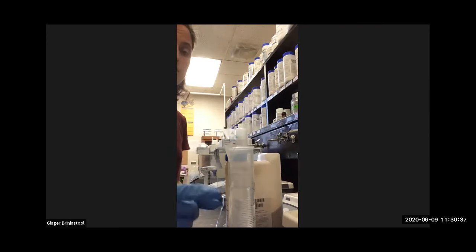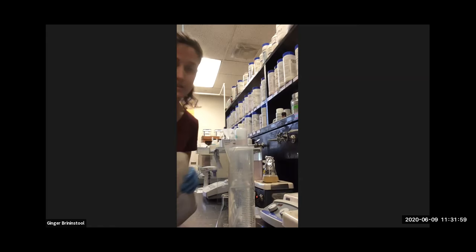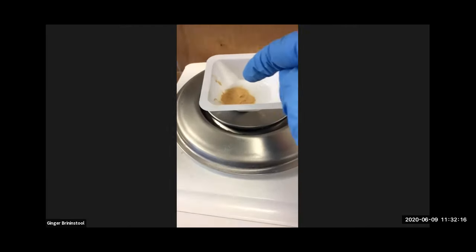Again, you should use a clean spatula, or the same one you used for the nutrient broth before. This is not the agar spatula, new spatula. All right, it's tared. It says 0. And now I'm going to go to just 0.8. Halfway there. All right, not quite as good as I did last time, but I got it, 0.8.